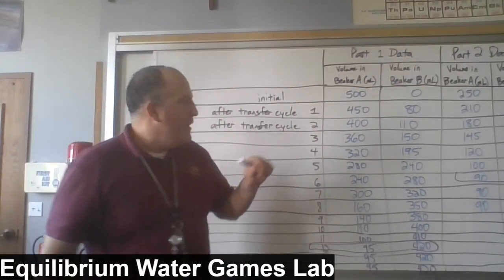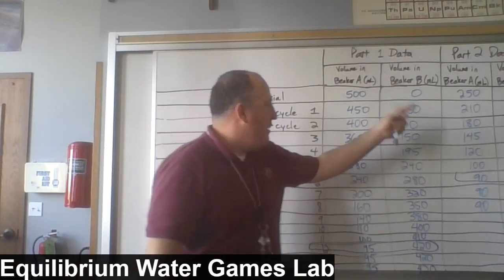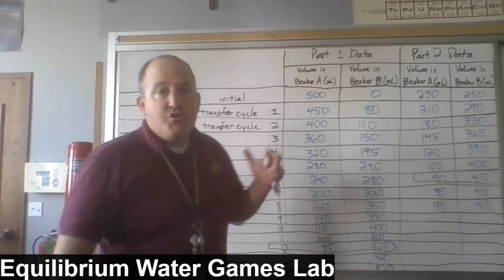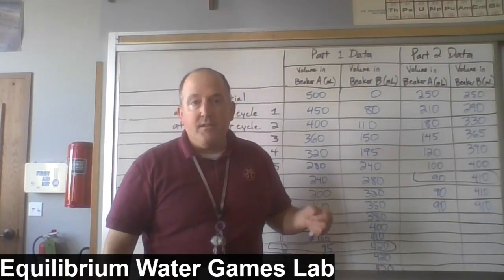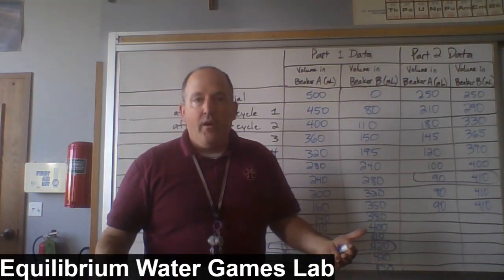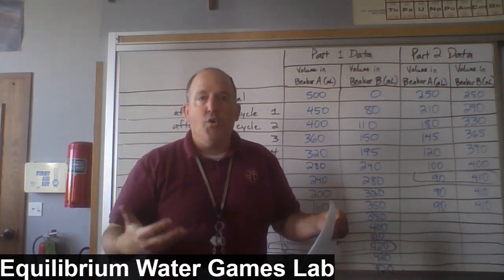Oh, one other thing to point out. When you add the two numbers in beakers A and B throughout any of these transfer cycles, theoretically, you should hit 500 on the nose, right? Because in each case, we started with a total of 500 milliliters of water. They may have been divided differently between beakers A and B, but we had a sum total of 500 mils of water.